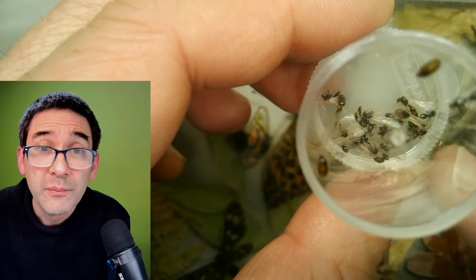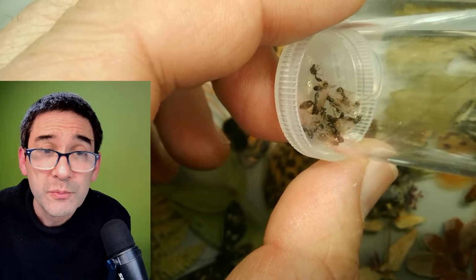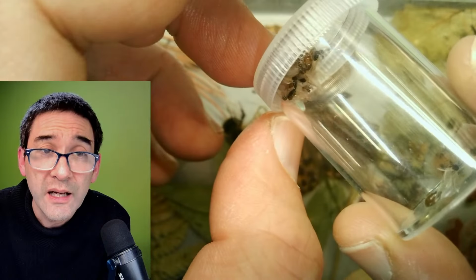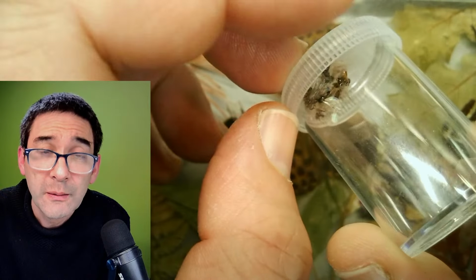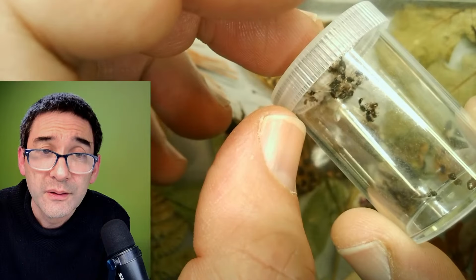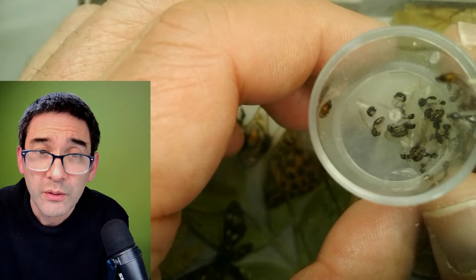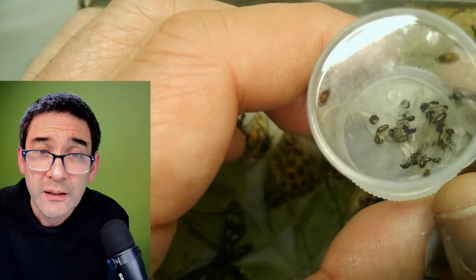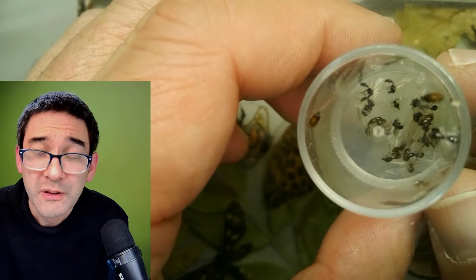So I've got a couple of interesting specimens, but this would be much easier to look at if they were preserved in some kind of resin block. But then again, they're easier to manipulate and hold because they're very fragile. And preparing them and putting them into a resin block might also be a little bit difficult.